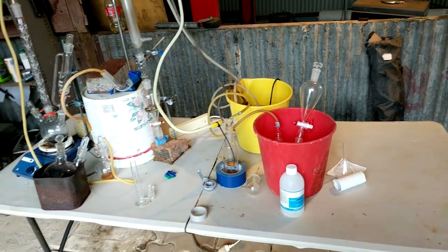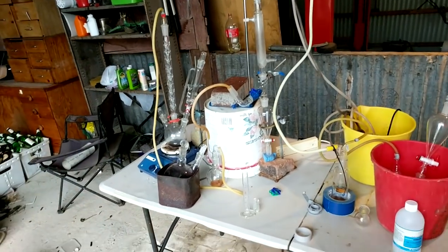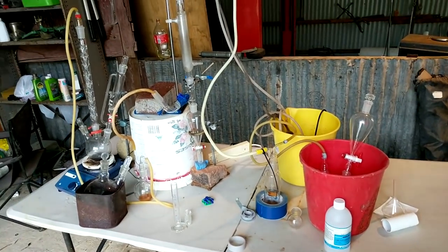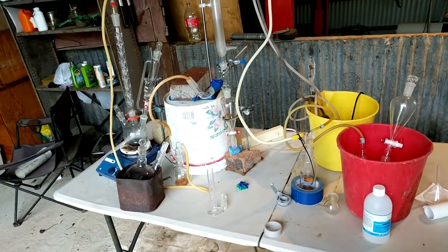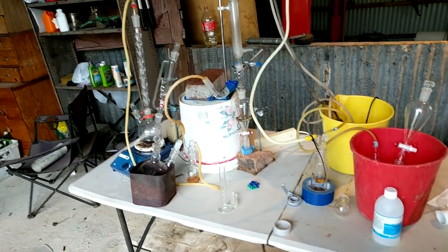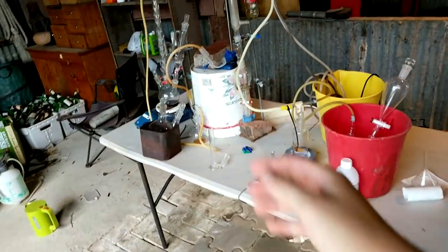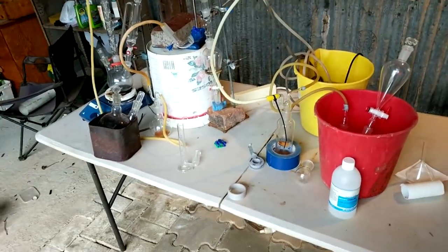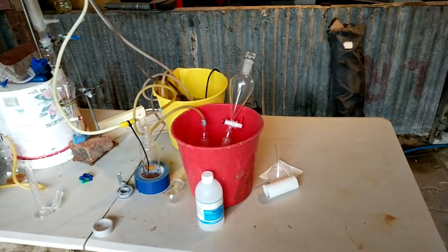Should be all right. It's just very complicated. And I mean, I haven't used the right tubing. The tubing isn't going to be resistant to the chlorine, but it should last enough for this run through. But unfortunately, I've run it very late because it took me about five hours to set this up. Now it's like 6pm and I'm just starting the experiment. So it's good that we're kind of in here. So we're out of the direct sunlight. Also, nighttime, there'll be less UV. So I guess that's a plus. But the filming is going to be a bit bad because lighting is going to be very bad as well.